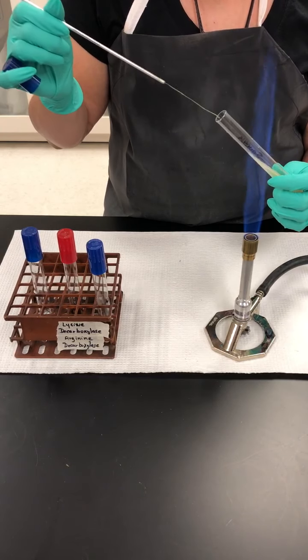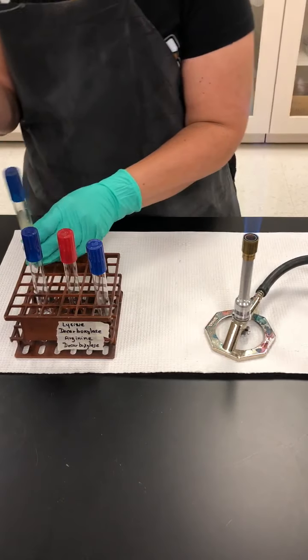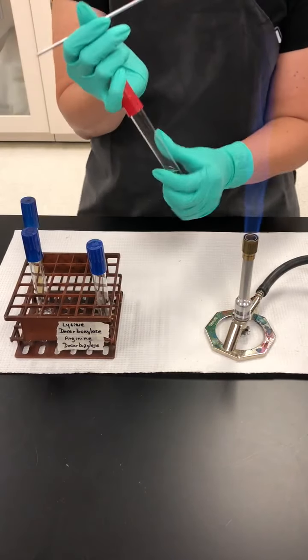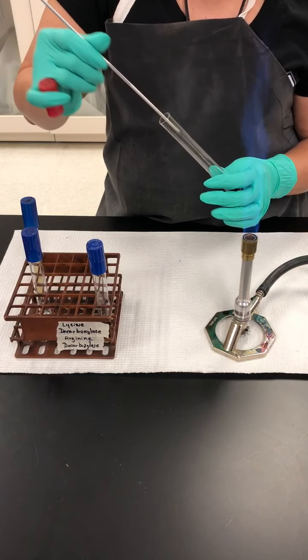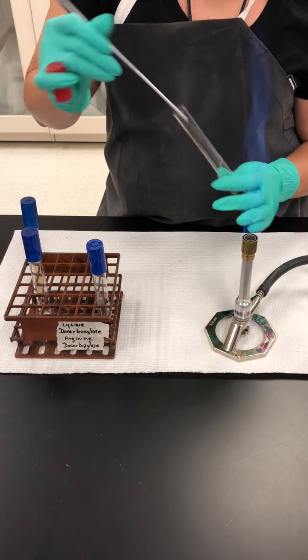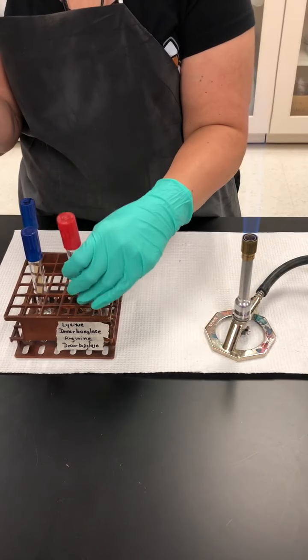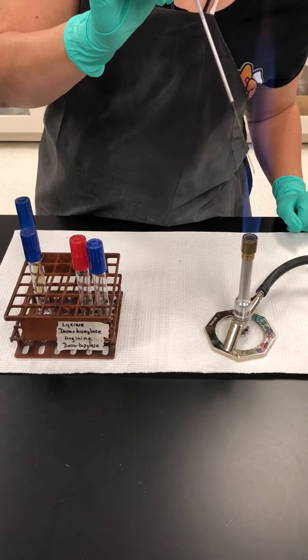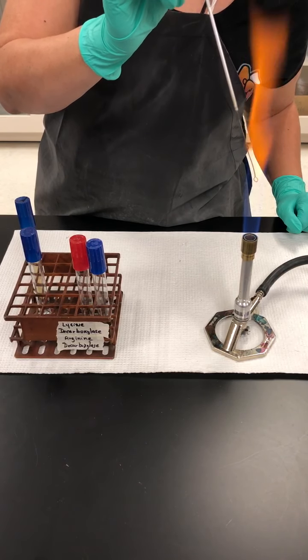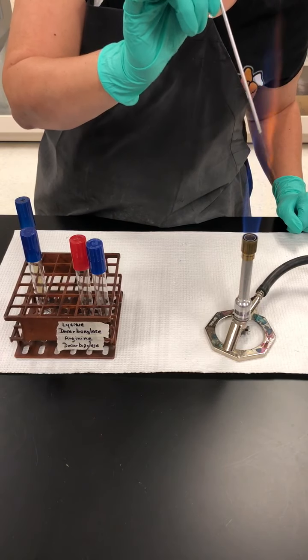We're going to go ahead and inoculate the next tube, which is for the arginine decarboxylase. In this case, we added arginine as an amino acid to the base of the recipe for this media. Now, the final touch after I incinerate the loop is going to be to add the mineral oil.